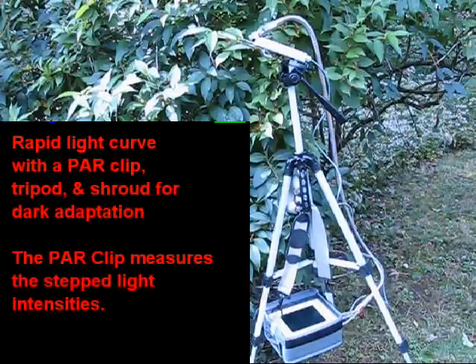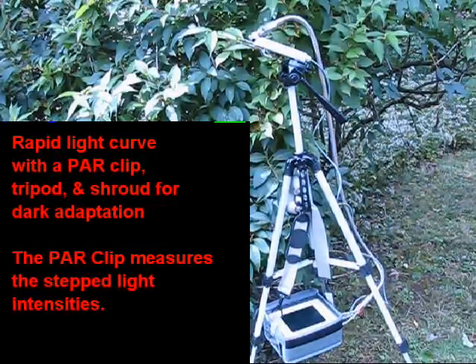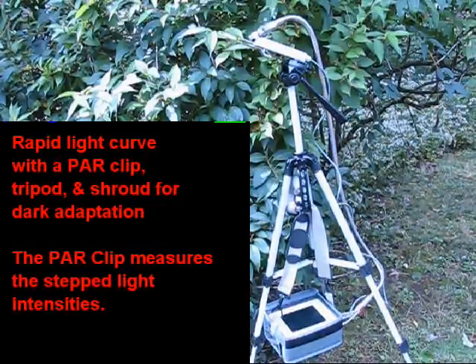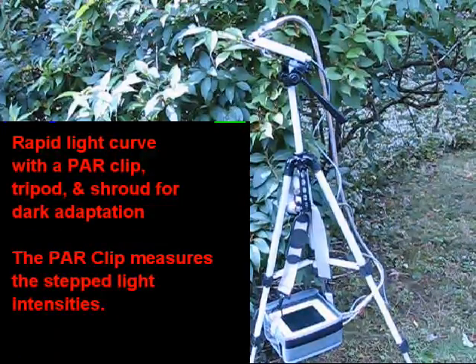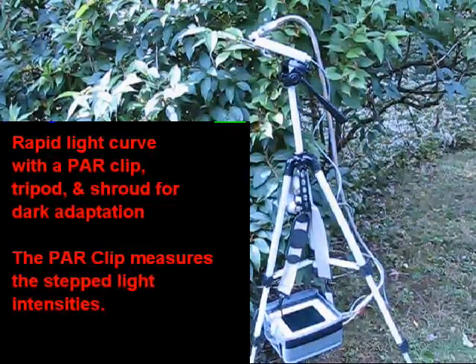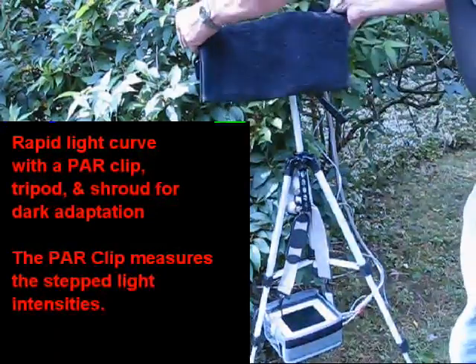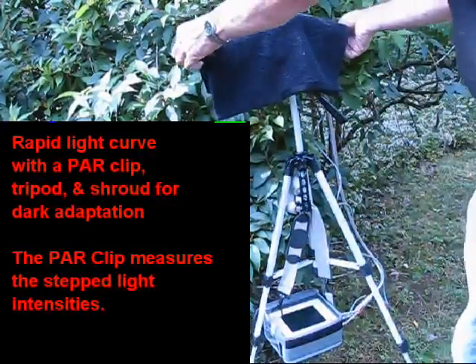Here we're going to measure a rapid light curve with a PARCLIP, tripod, and shroud for dark adaptation. The PARCLIP measures internal stepped light intensities and leaf temperature.